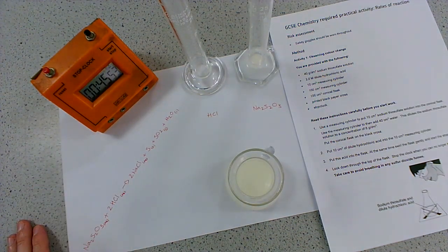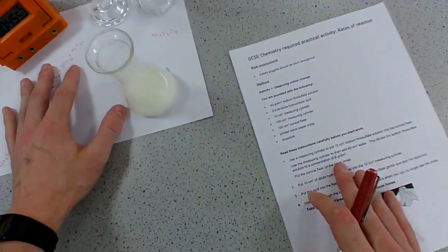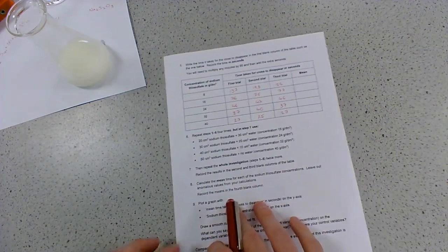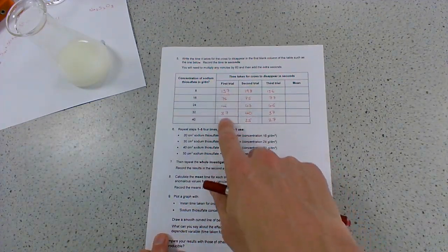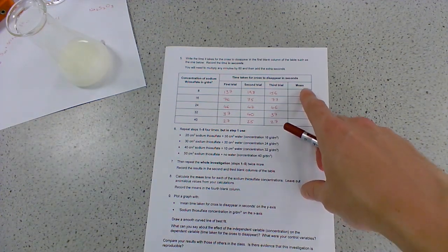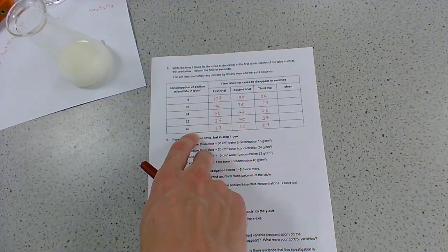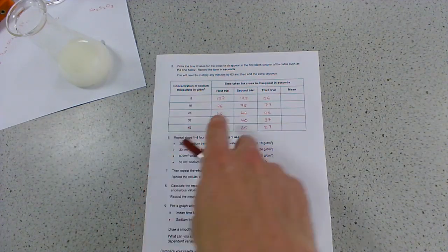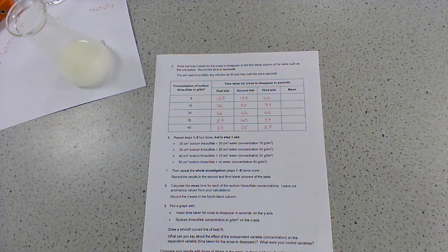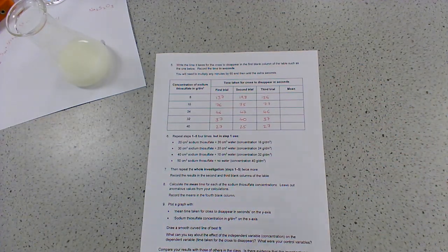So that's the disappearing cross reaction - a nice, simple, easy reaction with that nice cloudy colour. In terms of what you need to do, I've uploaded a copy for you to print. On the back you'll have some results - these are the results of the experiment done this morning. Calculate a mean value for each concentration of sodium thiosulfate. You can see clearly that as the concentration of thiosulfate increases from 8 g/dm³ to 40 g/dm³, the time taken very clearly decreases - it's going faster, the rate is increasing. Calculate the mean of these values and plot that as a graph with a smooth, continuous line of best fit.